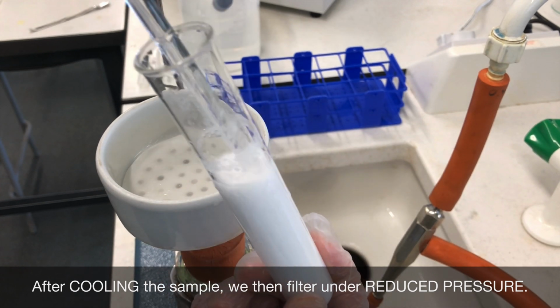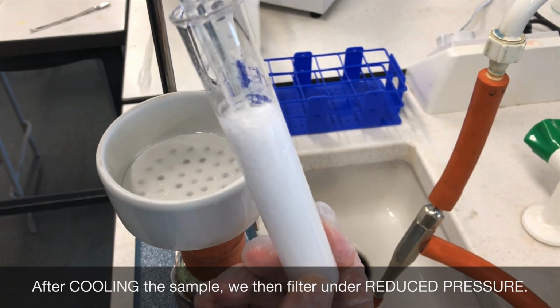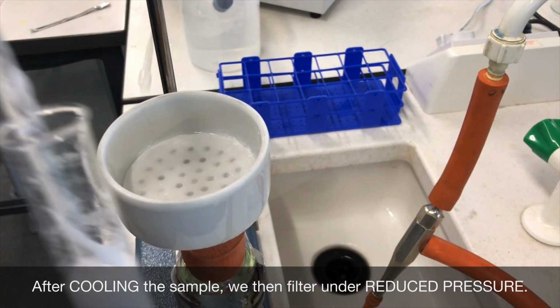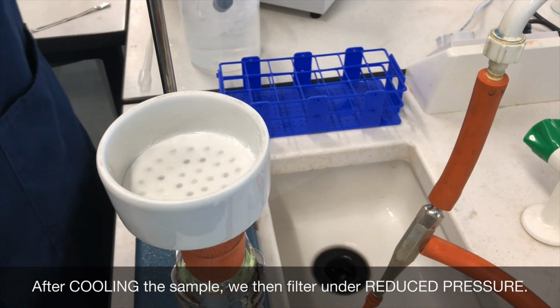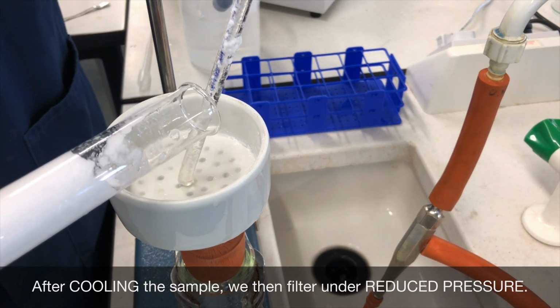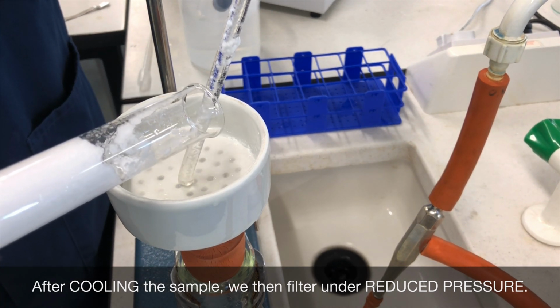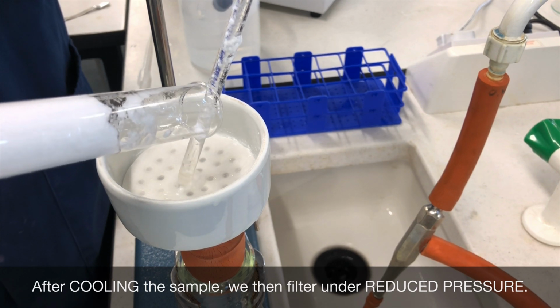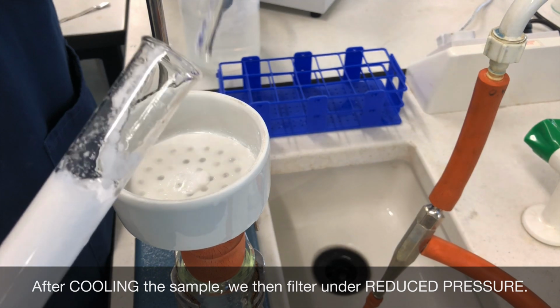Now that the solid has recrystallised and cooled, I filter it under reduced pressure using a Buchner funnel and a Buchner flask. The important bits of the procedure here to mention in the exam are that we cooled the mixture as soon as the minimum amount of hot solvent dissolved the original crude sample, and that we're not just filtering, we are filtering under reduced pressure.